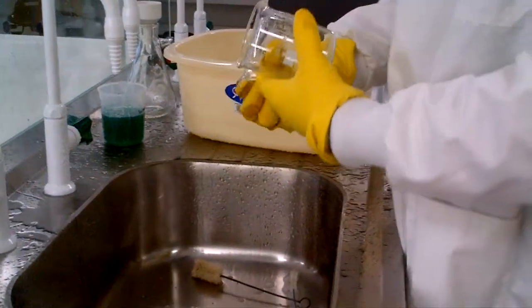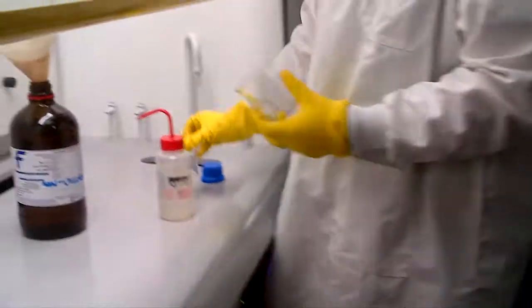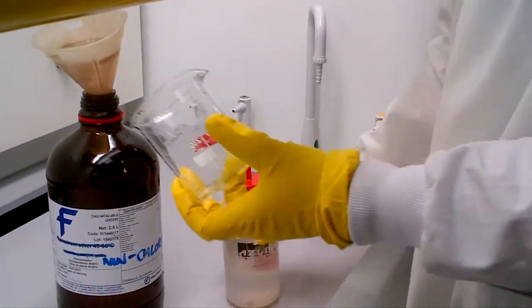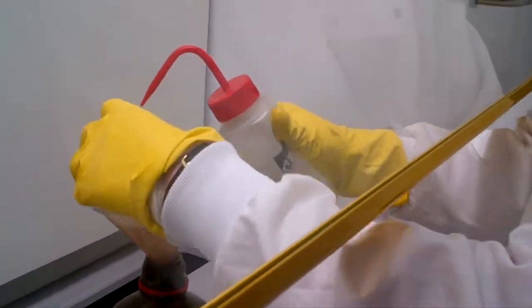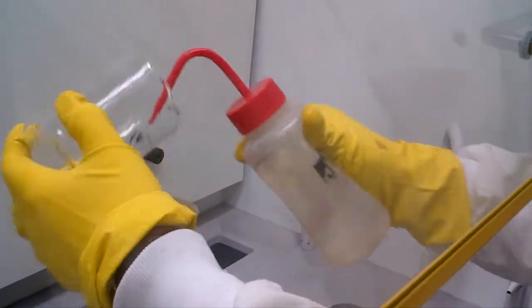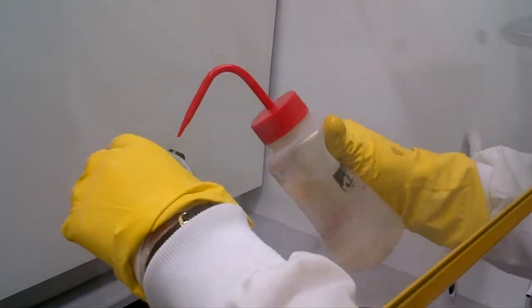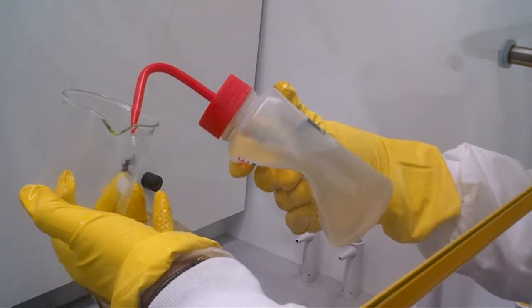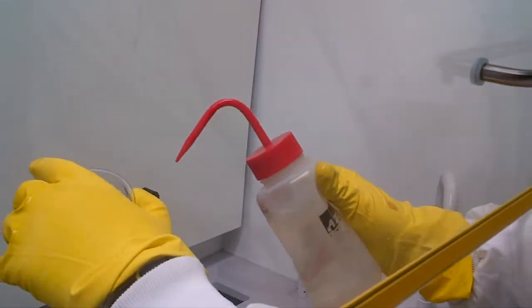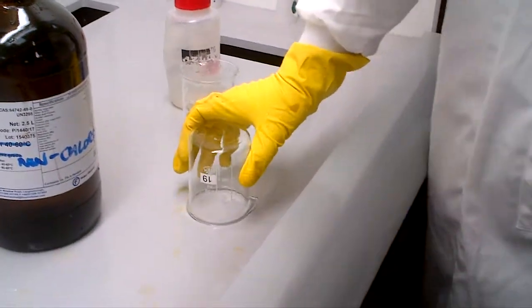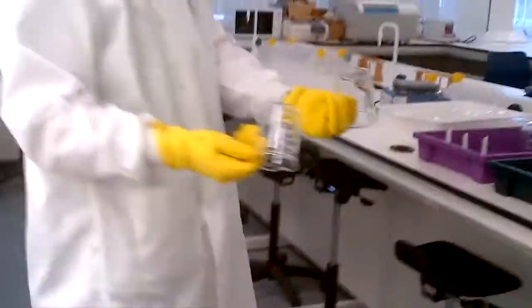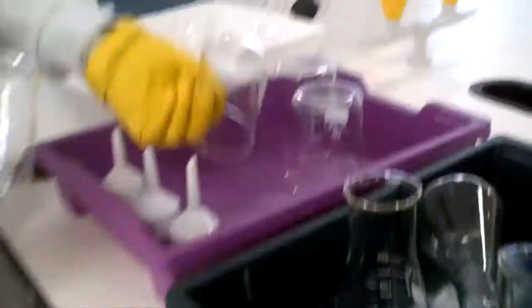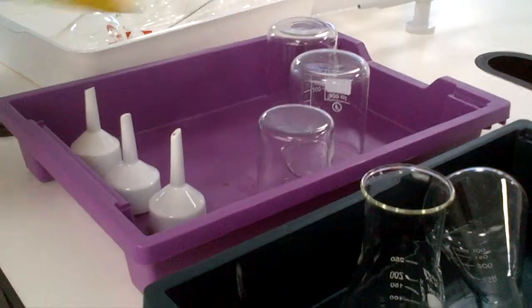Let's say we've washed a couple of beakers. We then go back towards our fume cupboard bay where our chlorinated, non-chlorinated waste bottles are. We use acetone as a wash bottle. We rinse the outside of the glassware first. Then we rinse the inside. Maybe the outside gets another go. We're trying to make sure all of the glassware has a wash with acetone. Are we happy with that? Yes, we are. So, we would leave that there. We would then collect our tray, place it all on a tray. And then we're going to move back towards areas of the labs. We're going to tell you where the clean glassware should go. We're happy we've washed our glassware up. We place it in appropriate parts.